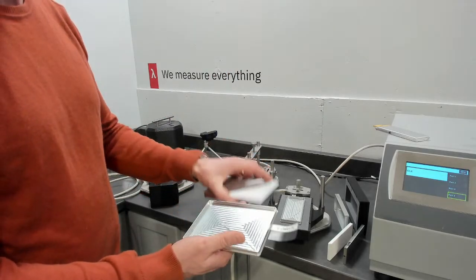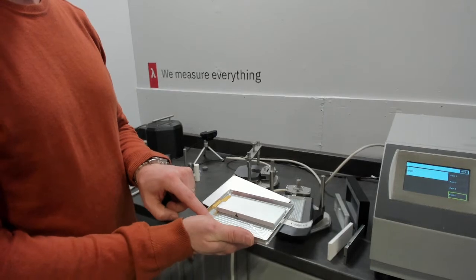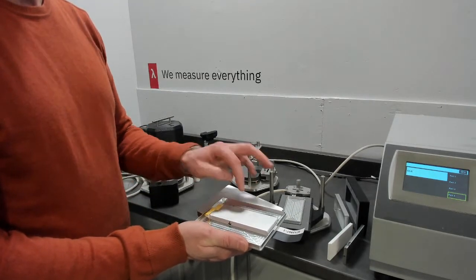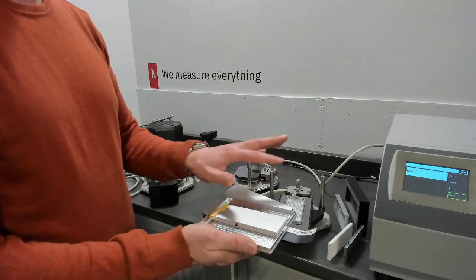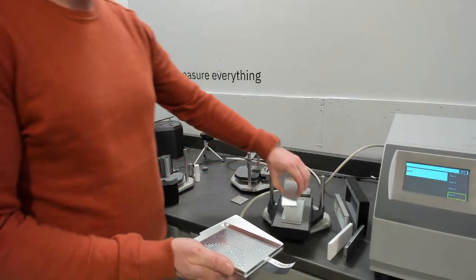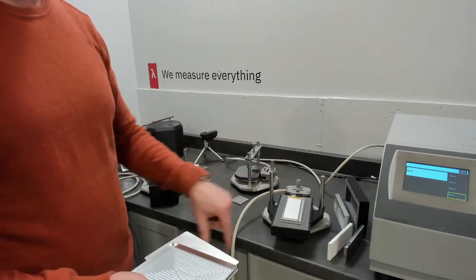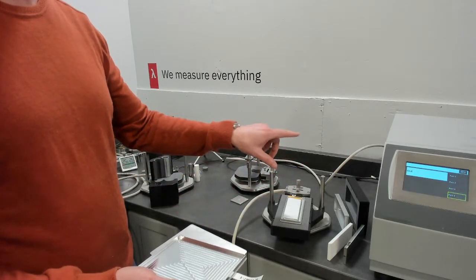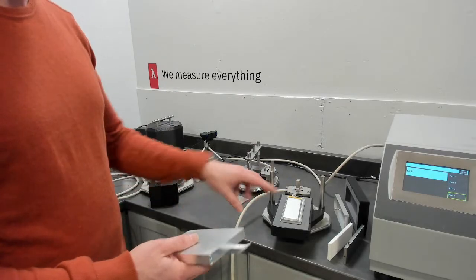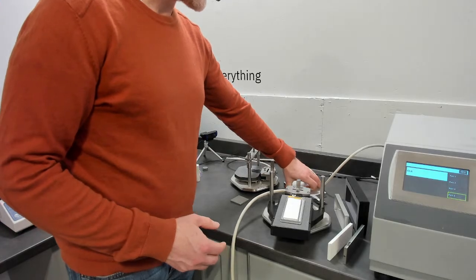Of course, you can use a much larger specific heat cell for a smaller sample. We try to cover a minimum of 40 or 50% of the area, but if we can, you just get more reliable testing if you can look at a specific heat cell that matches your dimensions a little bit better. So you're covering more of the test area. You're just more sensitive to that. So we have standard size cells, and then we can custom make specific heat cells.